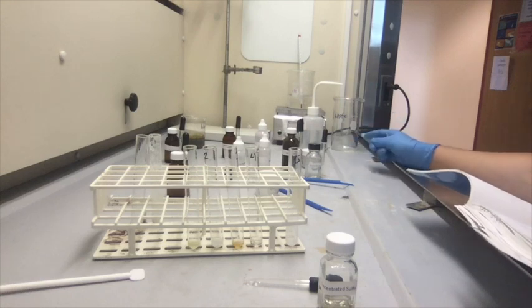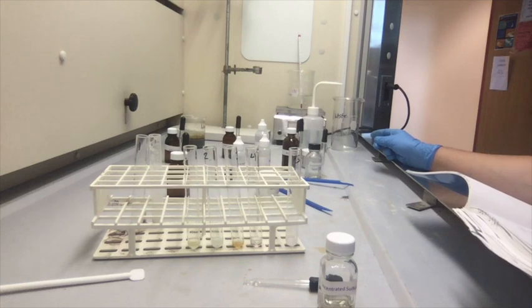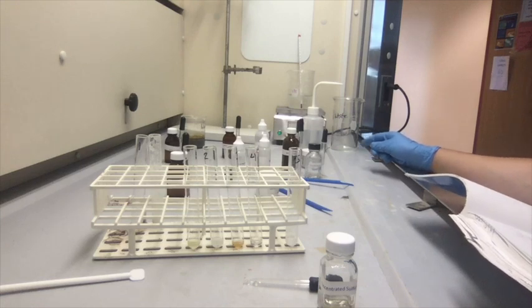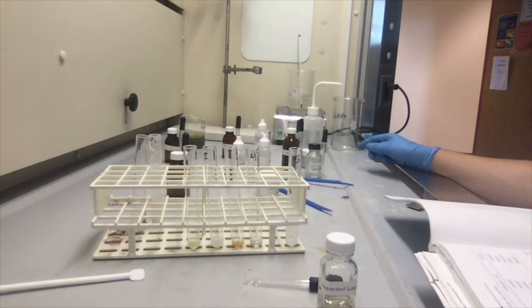So remove the test tubes from the hot water bath, cool, and add 2 mils of water to each. Note that there is a layer at the top of the water in each test tube. With a Pasteur pipette, take a few drops from the top of the layer and place it on a watch glass. Note the odor and match the esters from the test tube with one of the following odors: banana, peach, raspberry, nail polish remover, or wintergreen.